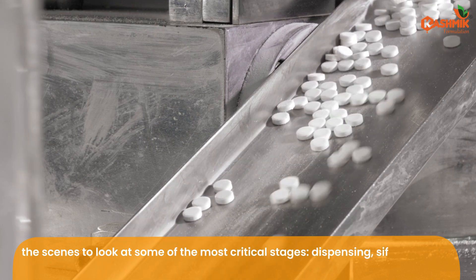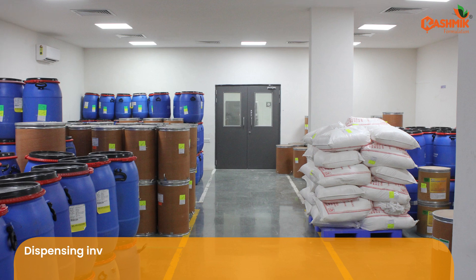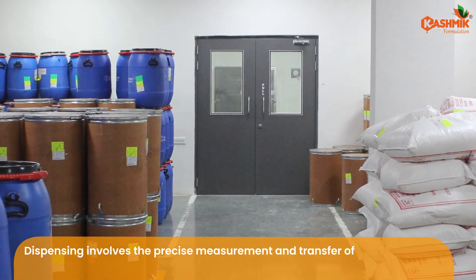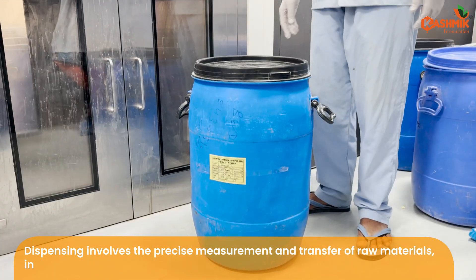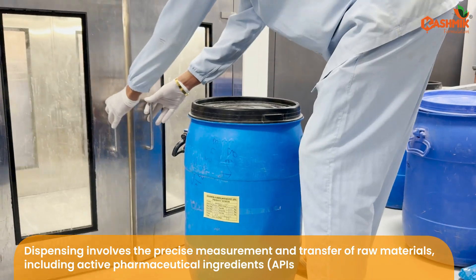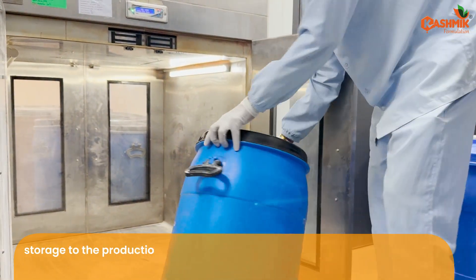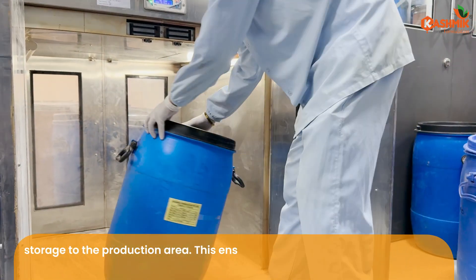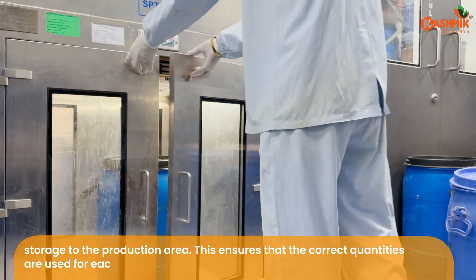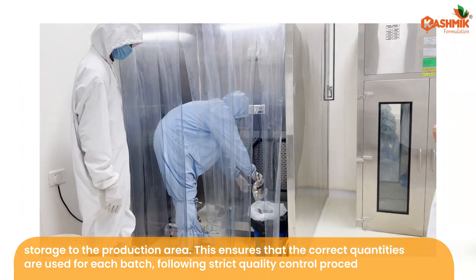Dispensing involves the precise measurement and transfer of raw materials, including active pharmaceutical ingredients, APIs, and excipients, from storage to the production area. This ensures that the correct quantities are used for each batch, following strict quality control procedures.